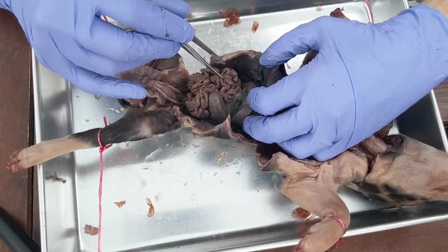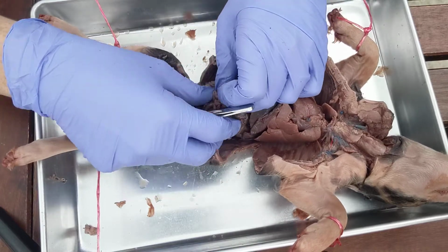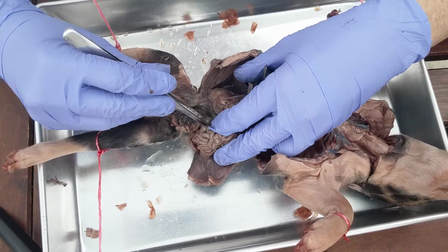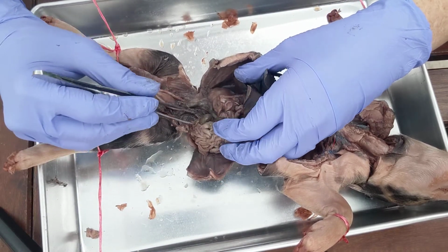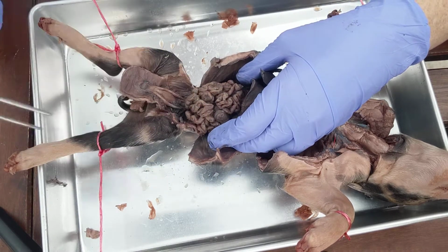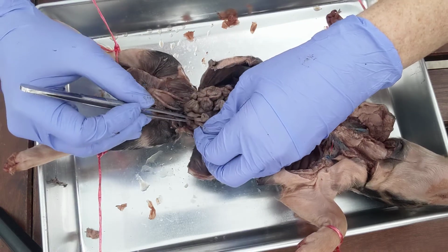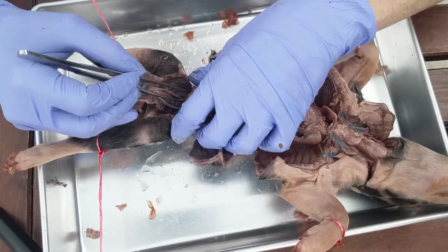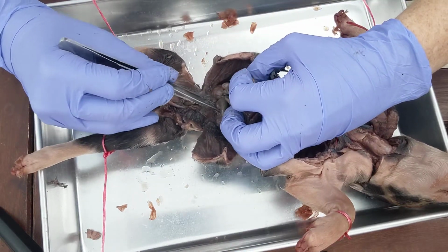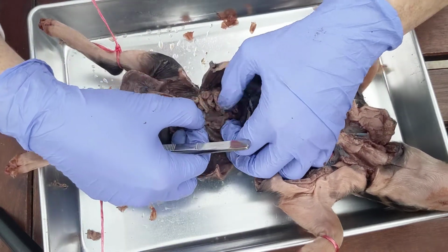Beneath all of that, we can see the intestines, and there are two different types of intestines. You have the small intestine and then the large intestine. So the major difference between the small and the large intestine is the size of the tube. Actually, the small intestine is by volume larger, but it has a smaller diameter, and so that would be the small intestine. And then the large intestine has a larger diameter, so that would be the large intestine. There you go.